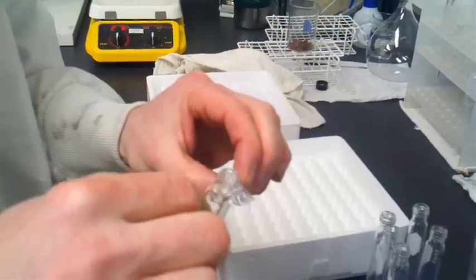The quantification of this color change is measured using a spectrophotometer and compared back to a calibration curve relating color to formaldehyde.